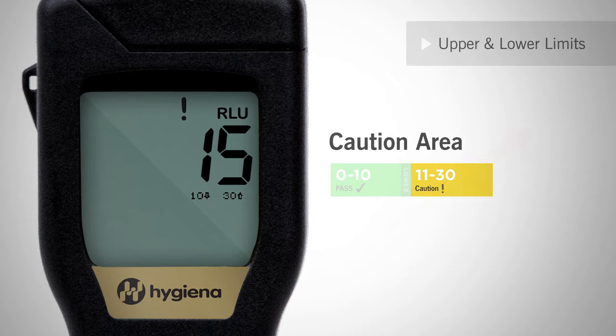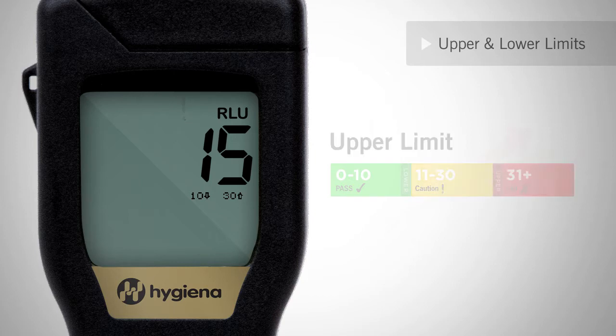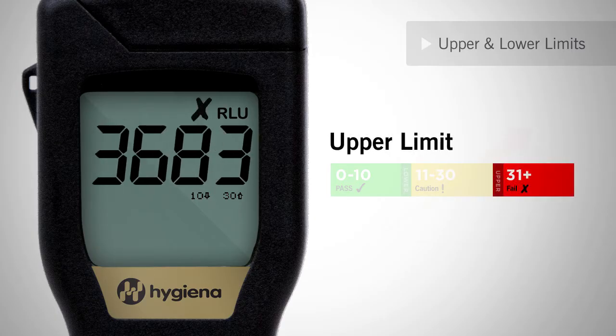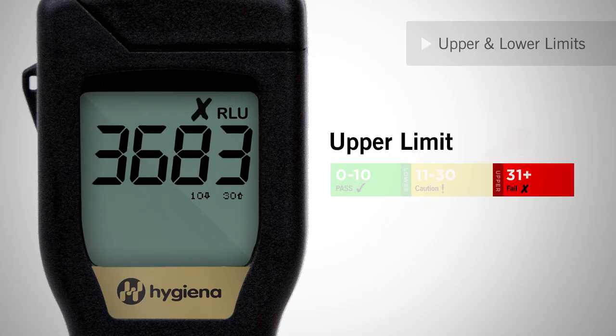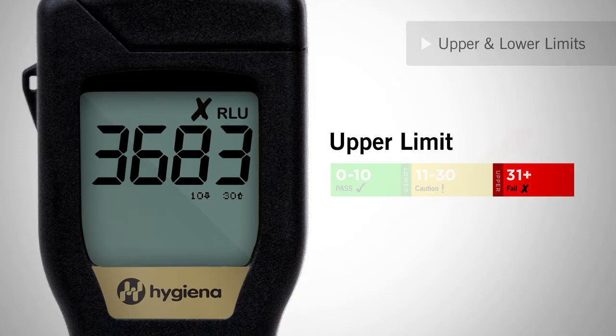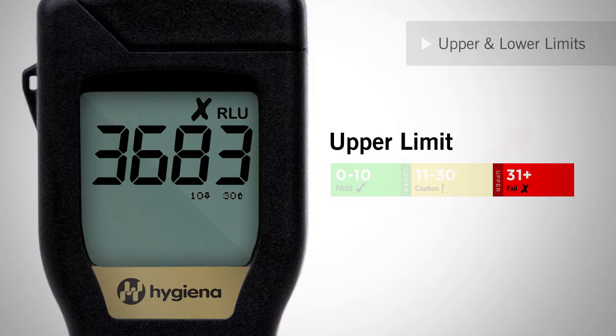A score greater than the upper threshold is a fail and will be marked with an X on the screen. A fail result indicates the surface is dirty or contaminated. The failed location should be immediately re-cleaned and re-tested until a pass or caution result is achieved.